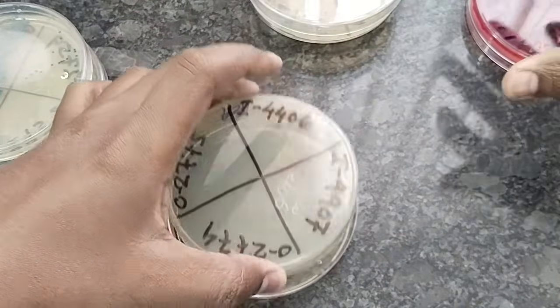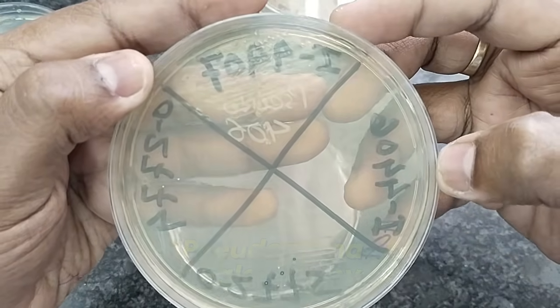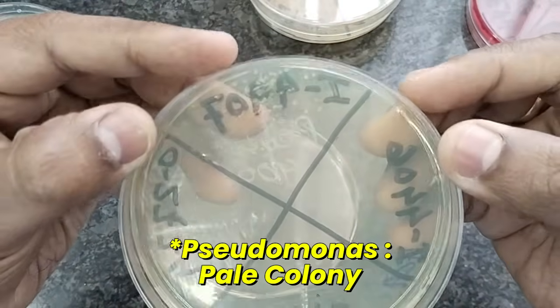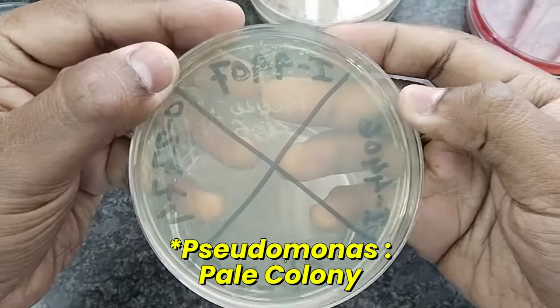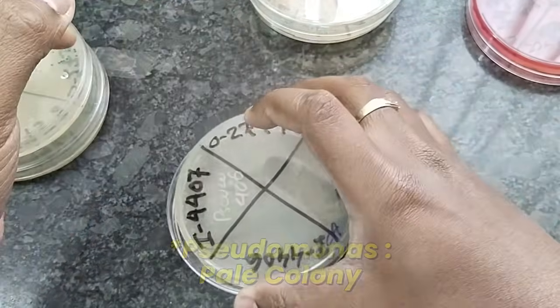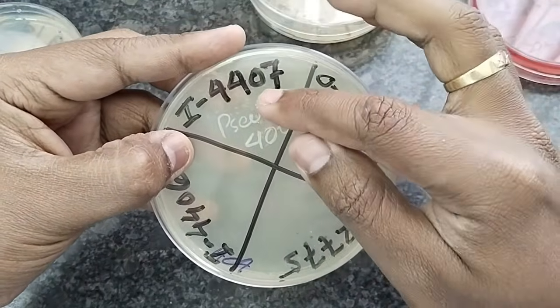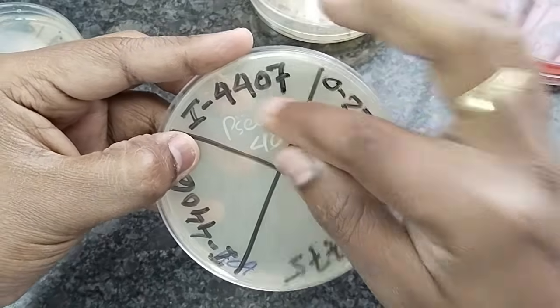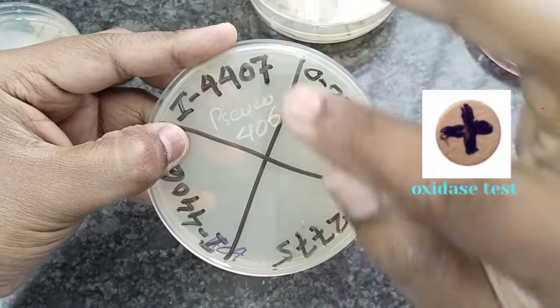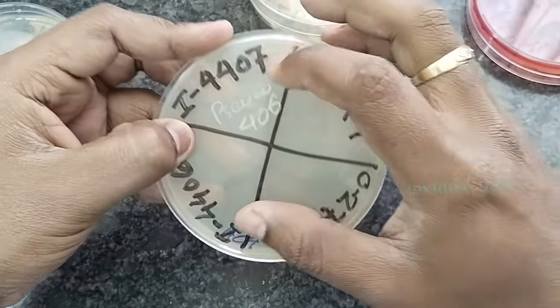And another colony I am showing you is Pseudomonas. The Pseudomonas colony produces no color. So we can see the Pseudomonas is pale, or there is no color at all. How can we identify the Pseudomonas? Do gram stain. It will be gram negative, obviously. And another confirmatory test for Pseudomonas is the oxidase test. As we see in the picture, the oxidase test will be positive. If the oxidase test is positive, then the bacteria is identified as Pseudomonas aeruginosa.